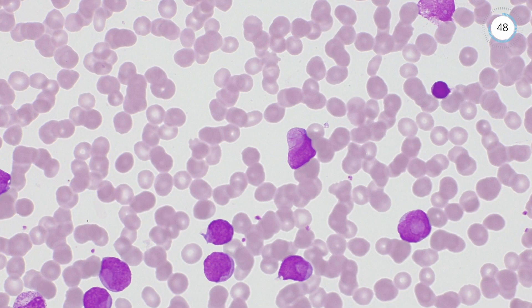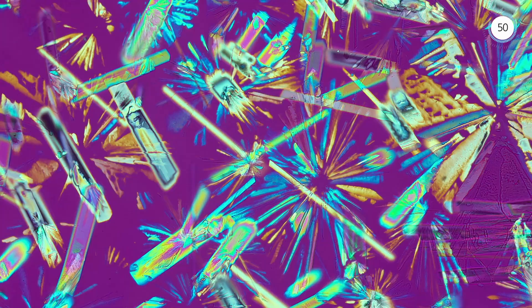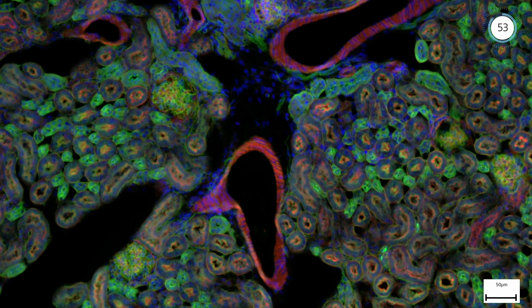Axioscope 5 provides bright field, phase contrast, DIC, polarization, dark field, or fluorescence contrast.